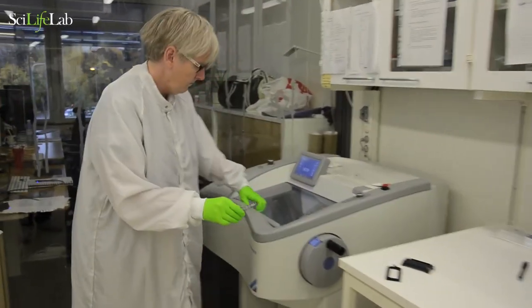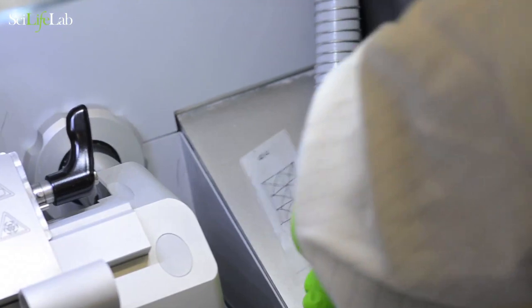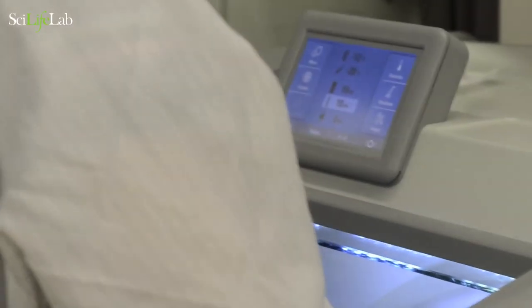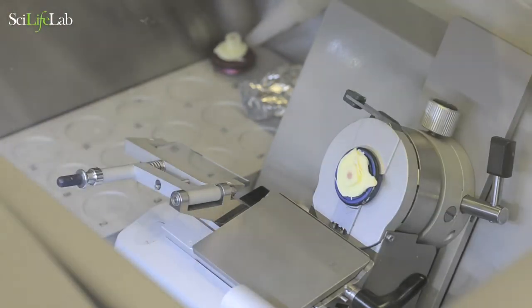Put the glass slide into the cryostat and keep it there during the sectioning and attachment. Discard a few sections first to get a clean surface on the tissue.